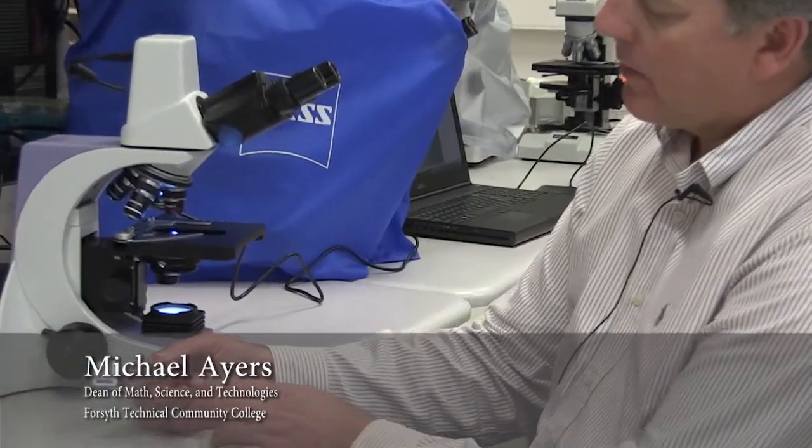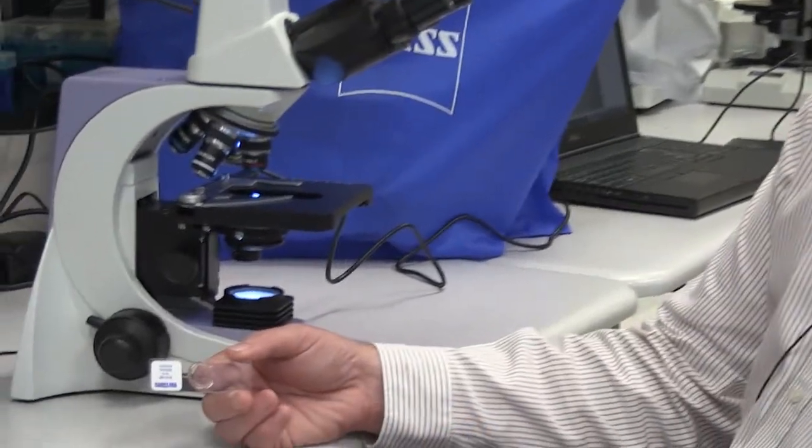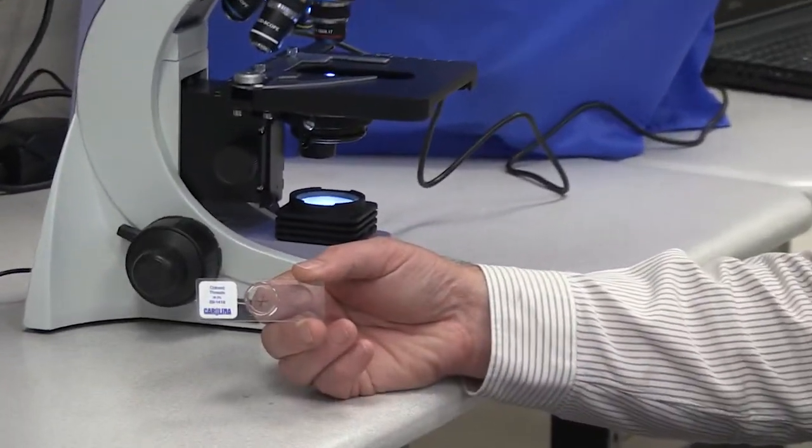Next, let's talk about how to use the microscope. We're going to use a microscope slide called the color thread slide.